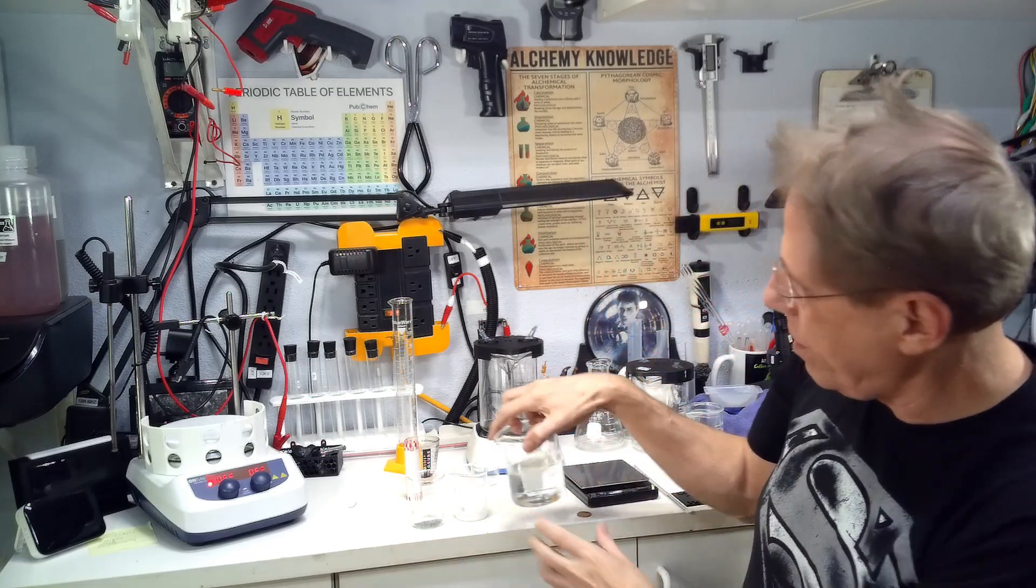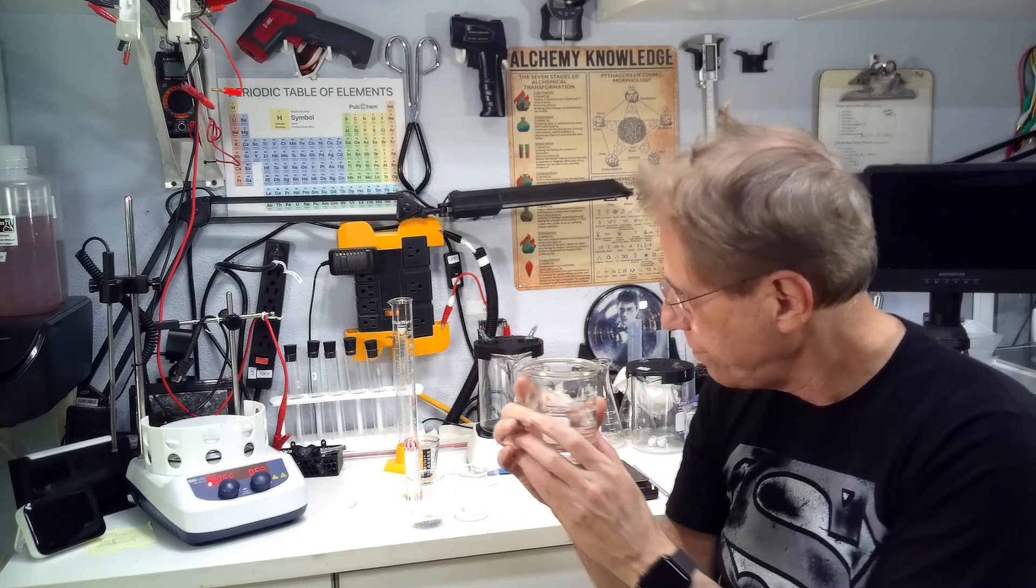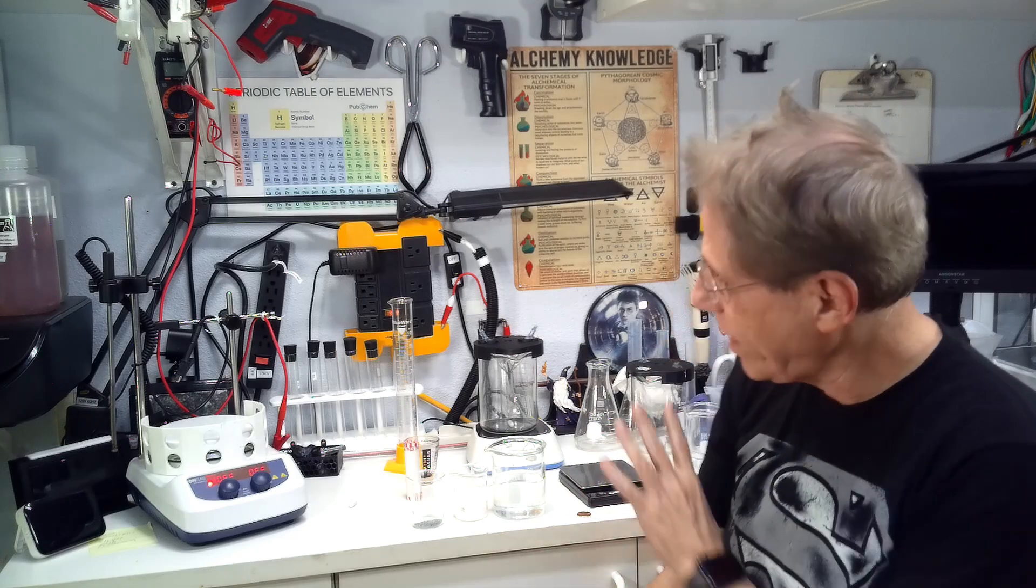We're also going to need 125 milliliters of water, distilled water preferably. And we're going to need to do some other things in order to progress this along. But that's how we get started.